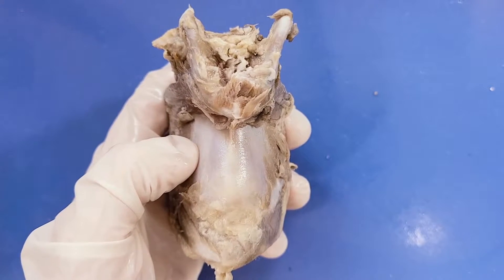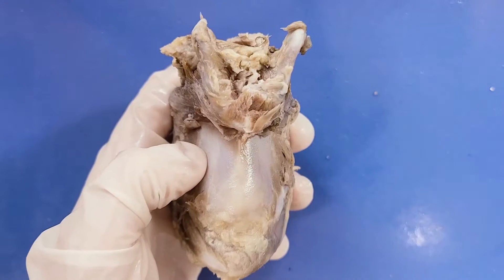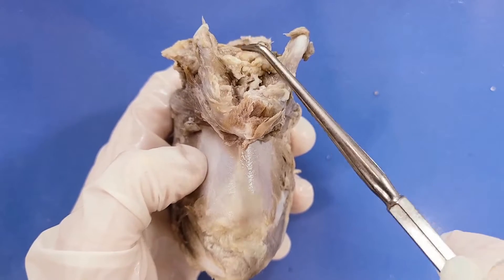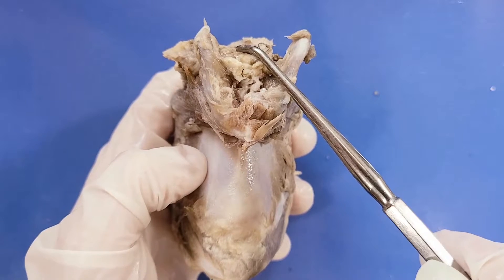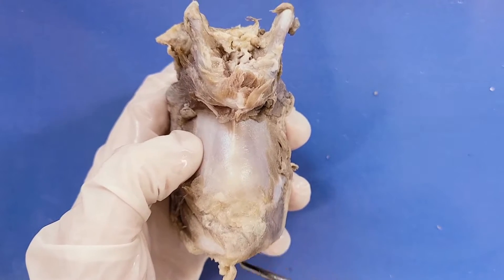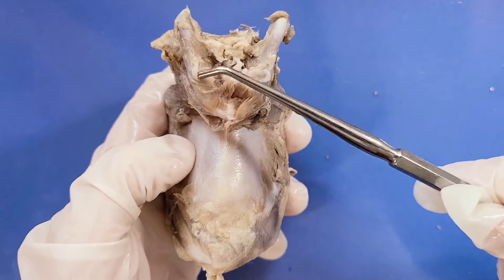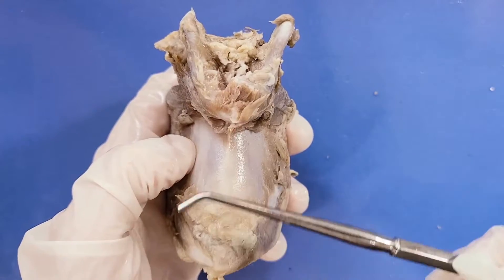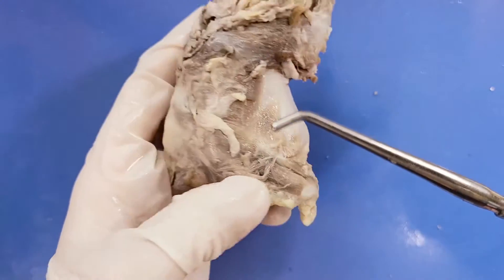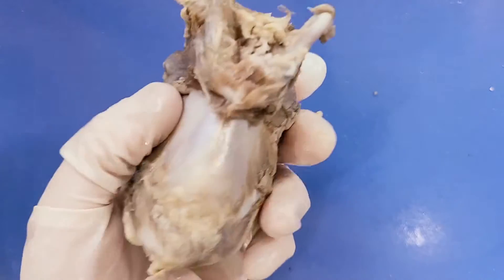Now that we can see the larynx, we can position it. Here is the superior end, which means near your head. And here is the inferior end, which means near your chest. Here is the anterior side, which means this is your front side. And here is the posterior side, which means this is near your back.